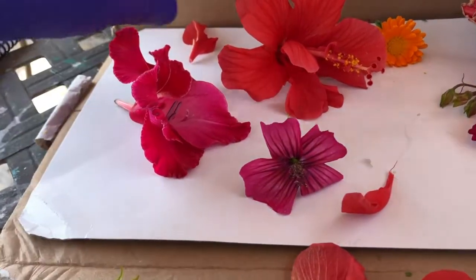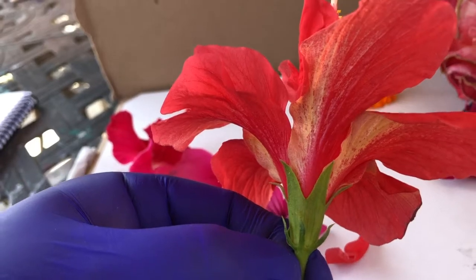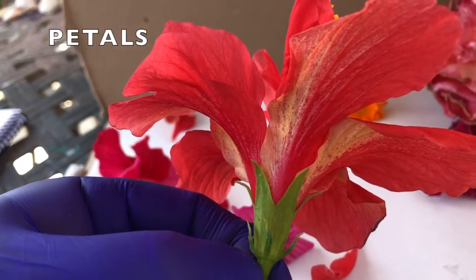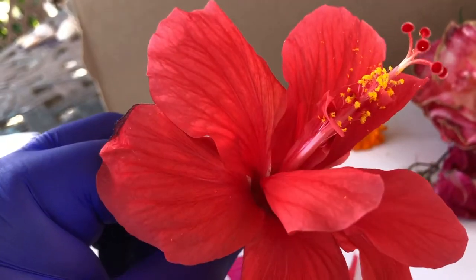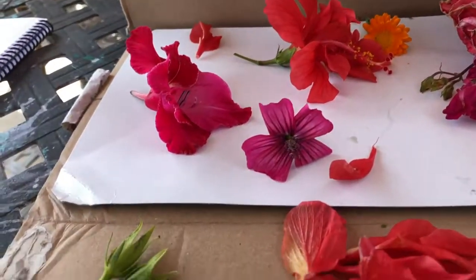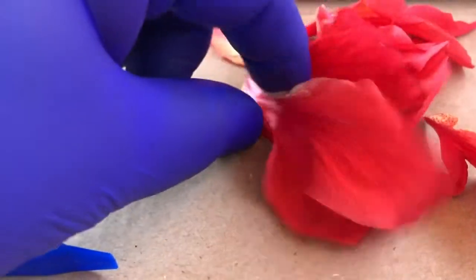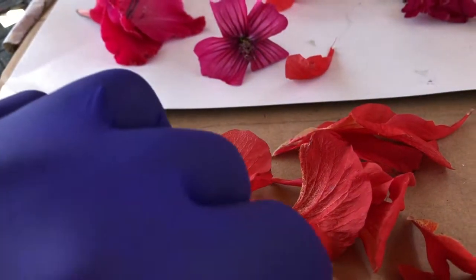The next thing that we would see after the receptacle are all these beautiful petals. Now the petals, the color of the petal or the fragrance of the petal is key in really attracting the different pollinators that it has a relationship with. And so in this case, we've gone ahead and taken off all the different petals from this flower here and put them all to the side. And so what we ended up with after we took off all these different petals is this thing right here, which is actually called a pistil.